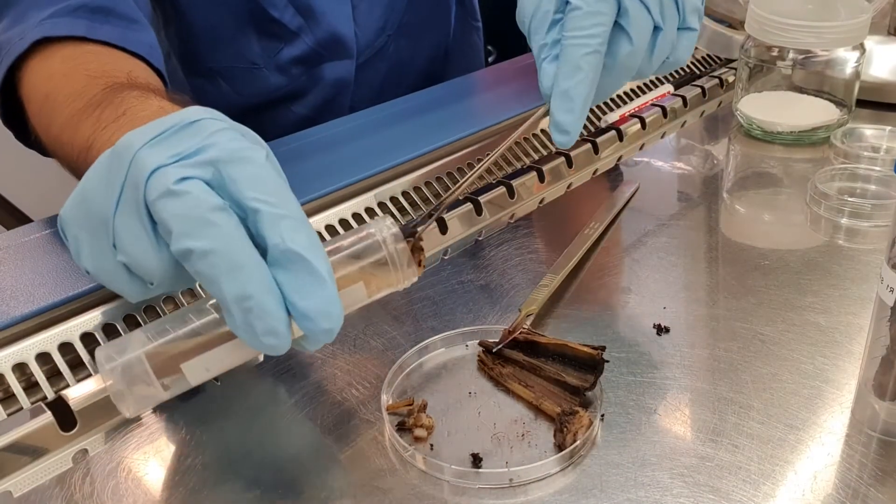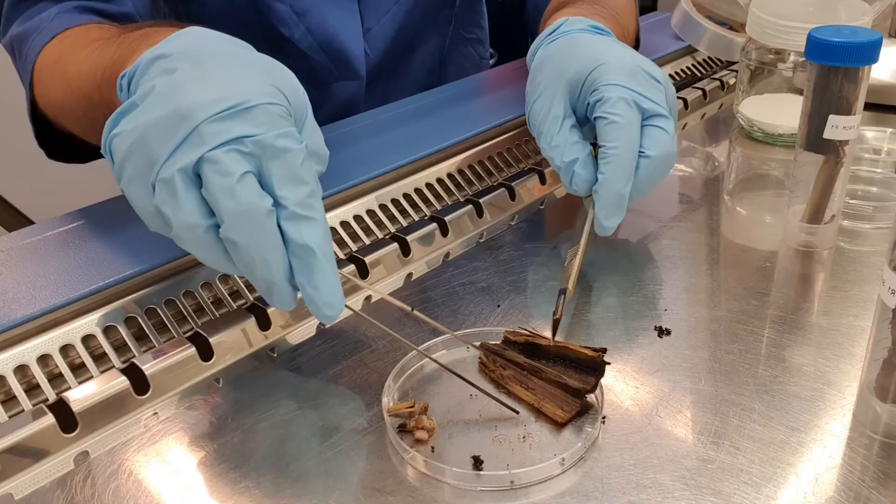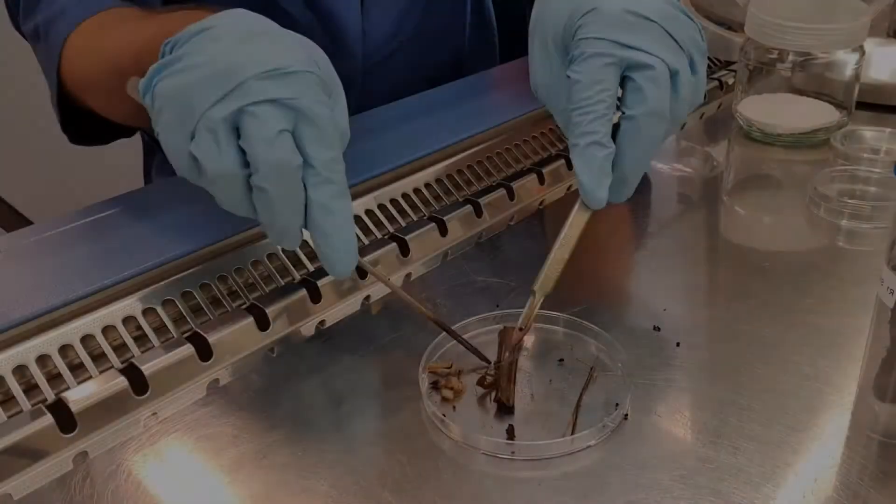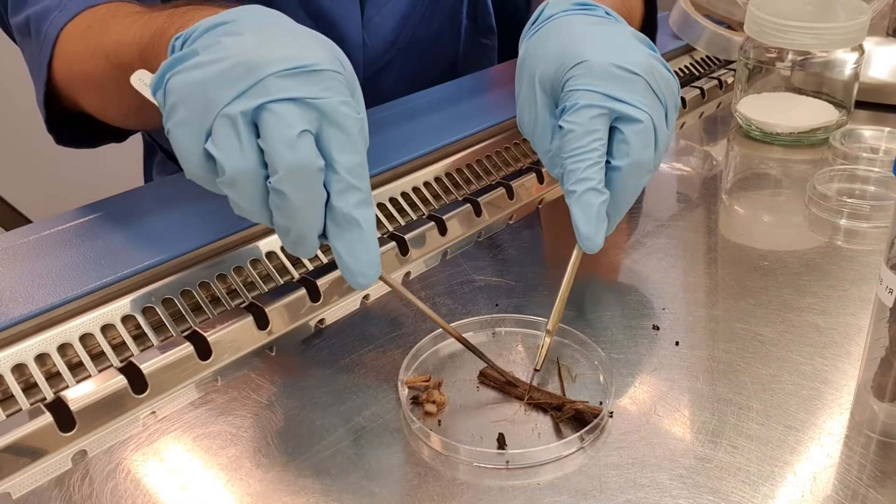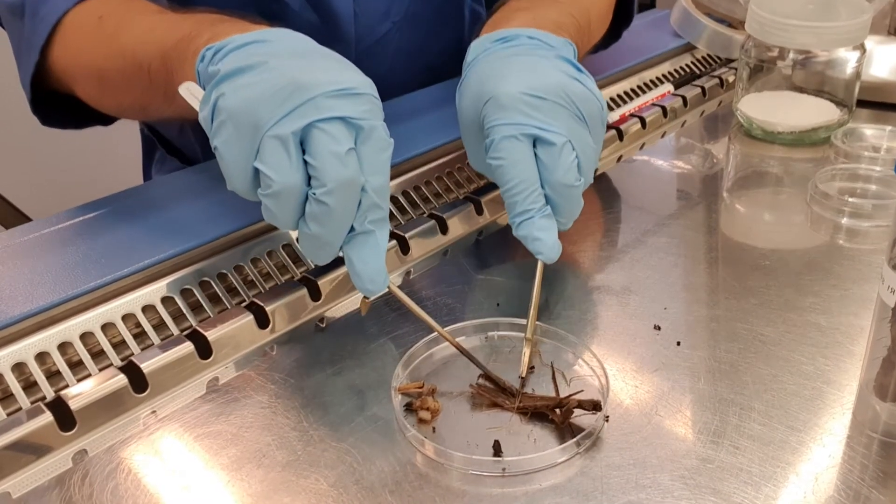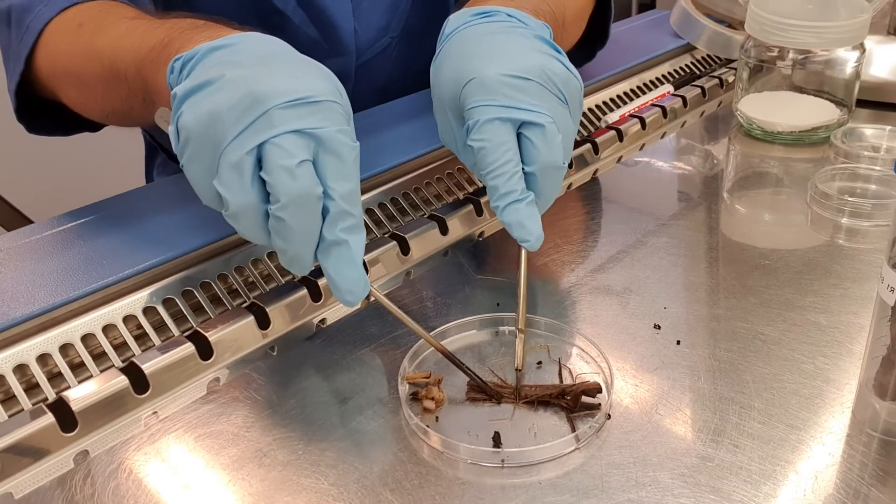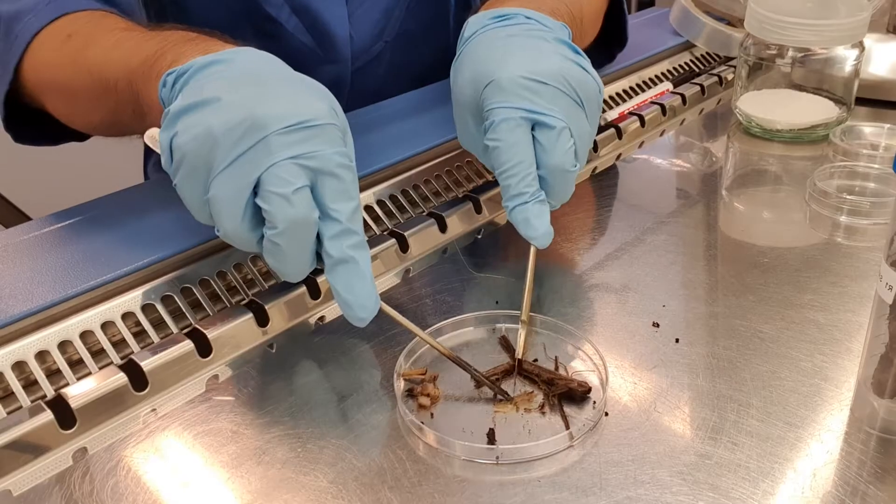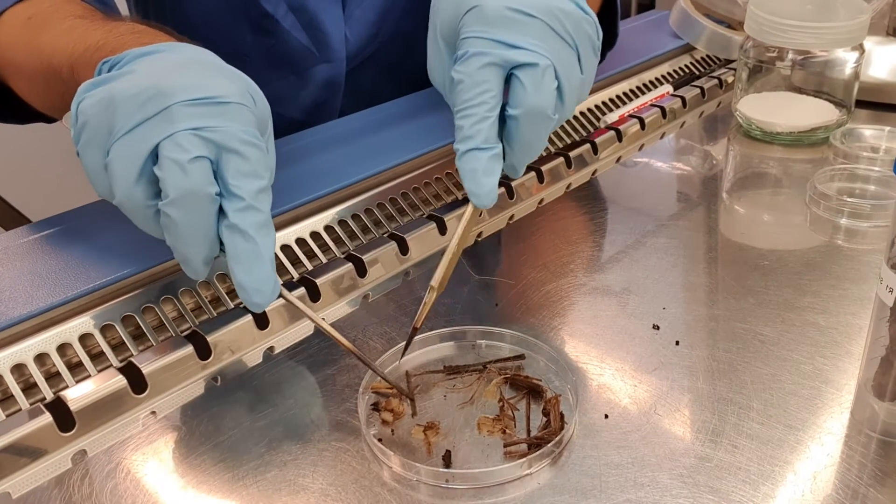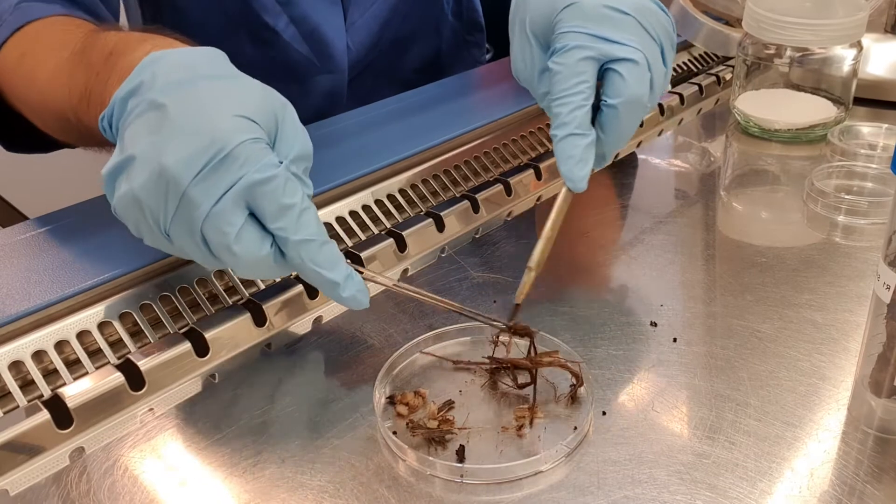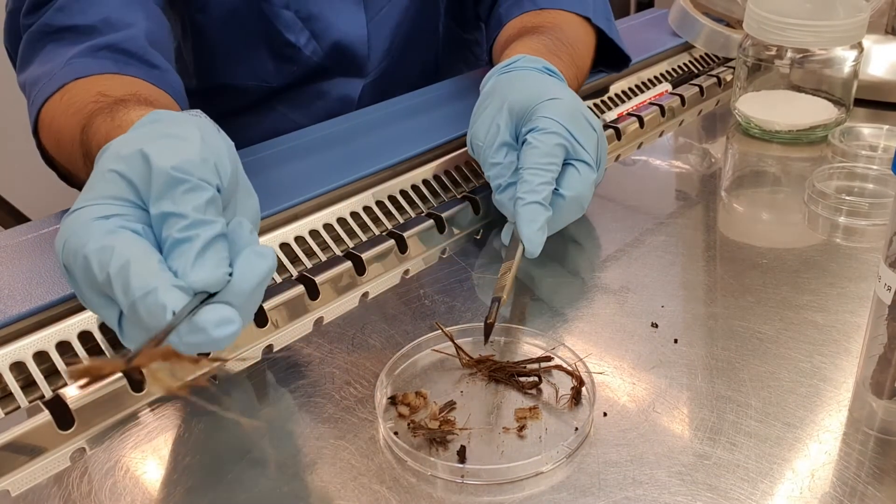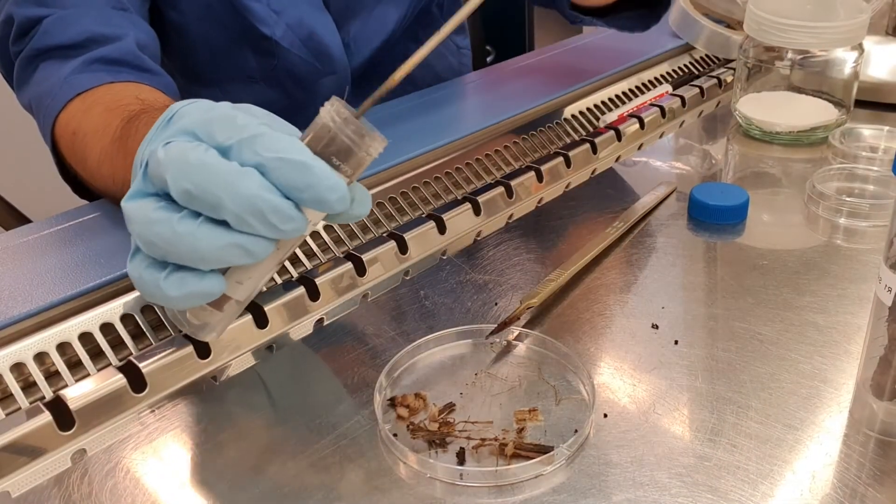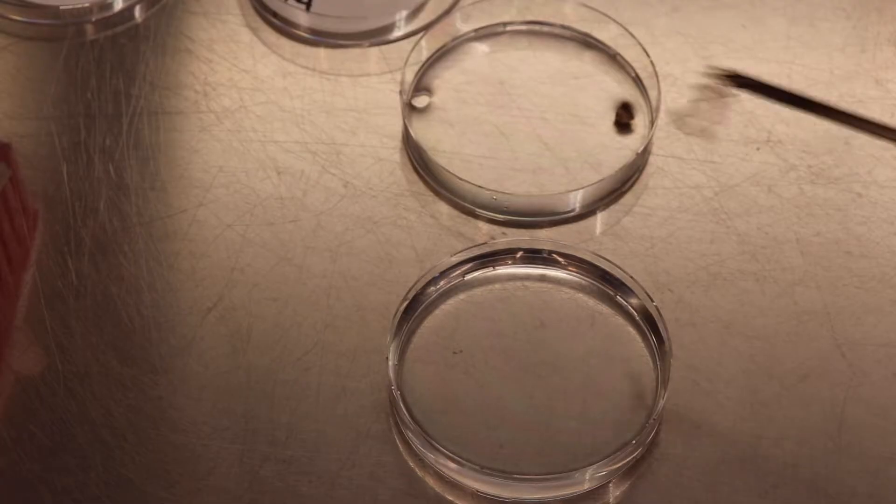We save the rest and we continue with this material that is more difficult. As you can see, it's very soft but also full of fibers. That makes cutting a little bit complex, as you can see here. When you manage to take small pieces, you can use those ones to isolate the fungus, something like this. I'm going to take this big piece and I will put it in the bleach just to show you how they turn in a different color. And you can observe the vascular tissue colonized by fusarium. And those are the pieces that we are going to use to re-isolate the fungus.